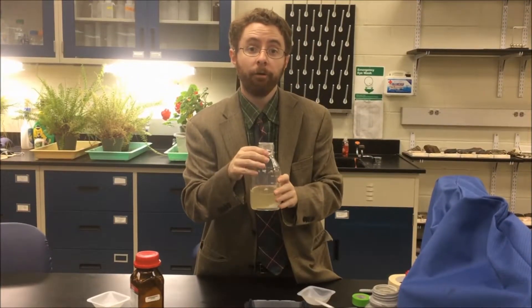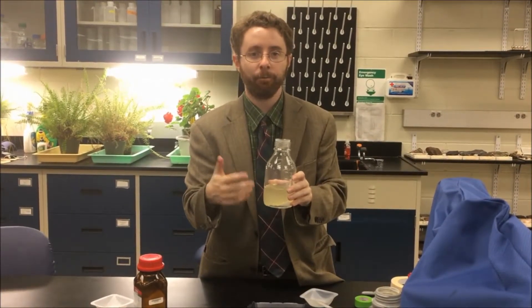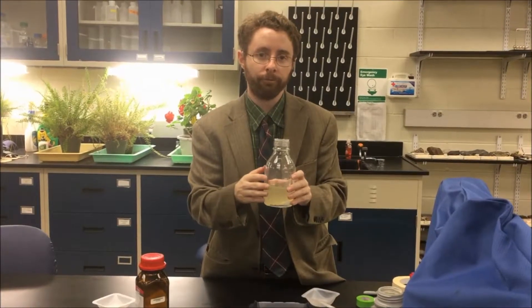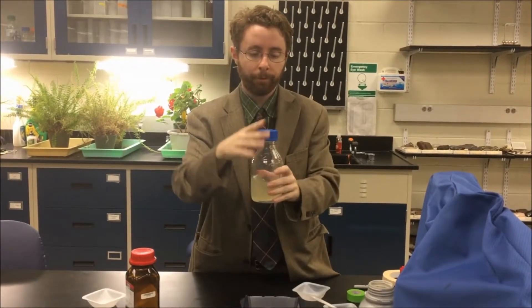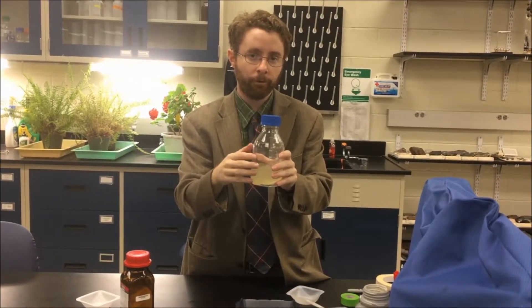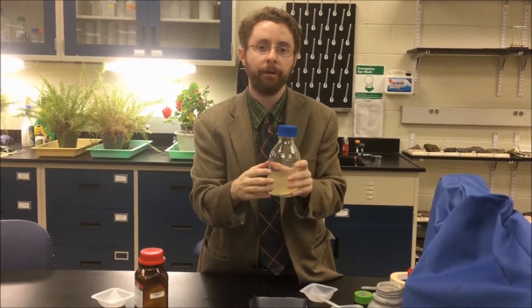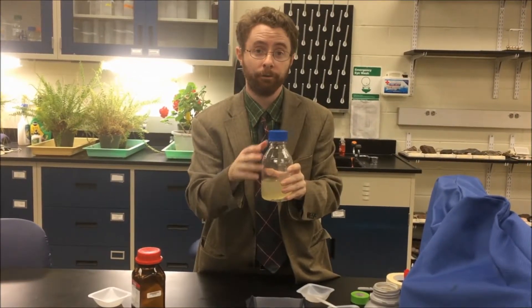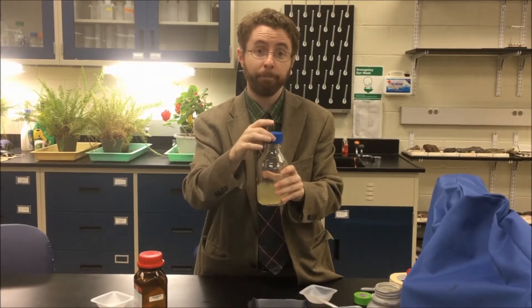Now this is ready to be autoclaved or sterilized, because we don't want any other microorganisms to grow in our media except the ones that we purposely inoculate. To prepare it for autoclaving, we take our cap and close it, but we don't want to seal it all the way. When we put this into an autoclave, the autoclave sterilizes liquid and other equipment using temperature and pressure. To make sure that the flask doesn't break, we're going to keep the cap loose.